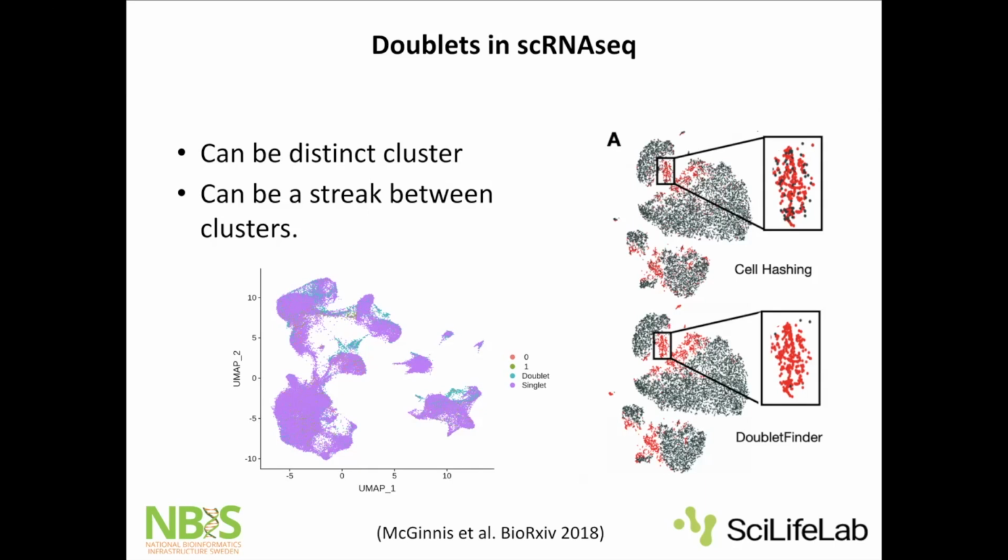Another big issue with doublets is if you want to do trajectory. So in this project, we do have a transition of cells going from this cell type to this cell type. And they were super interested in studying this transition of these two cell types. Now, it's super tricky to see where I have the doublets and where I have cells that are sort of half in between two cell types. But actually, we managed to try to find stuff that has more signal than just a mix of two cell types. But this will become super tricky.